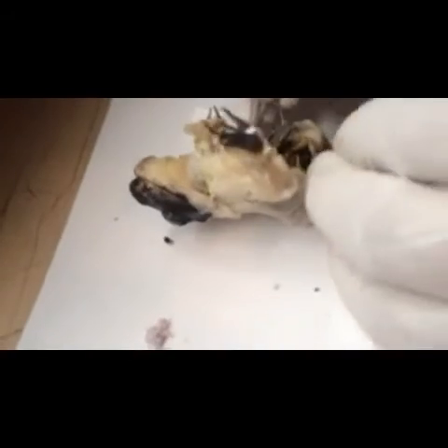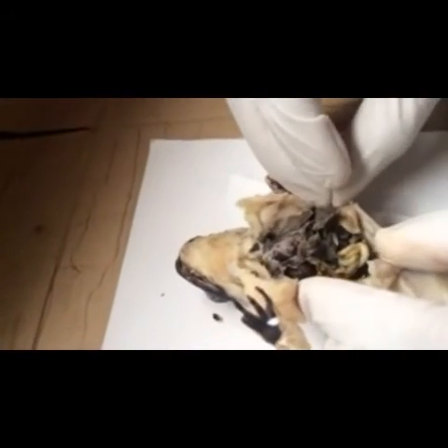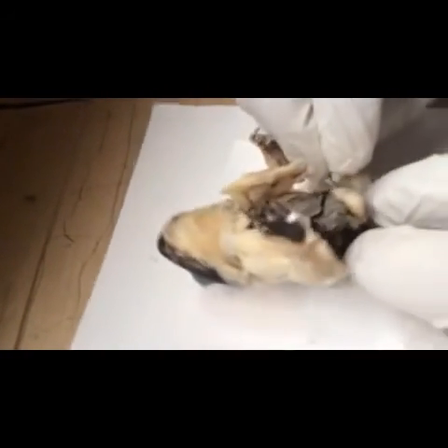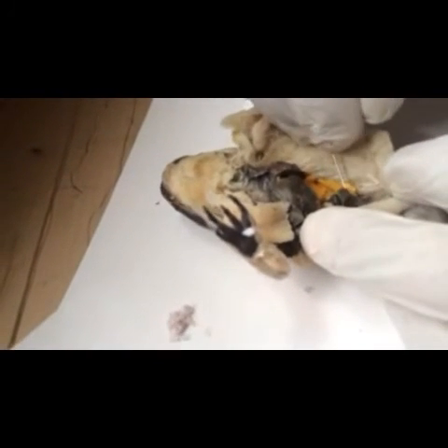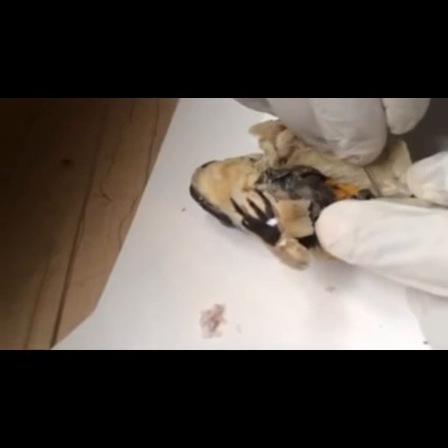And then we will proceed to the ileum — the most coiled part of the intestines. Then we will go to the large intestine. This is the large intestine. And in the large intestine, at the middle part, that is the mesorectum. And then cloaca. And then below the cloaca is the anus here.